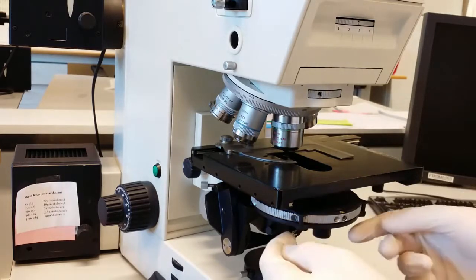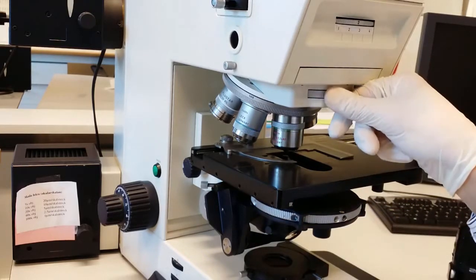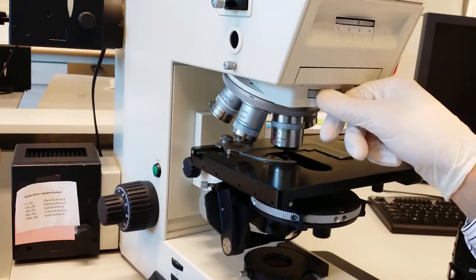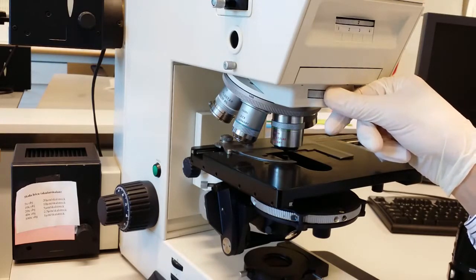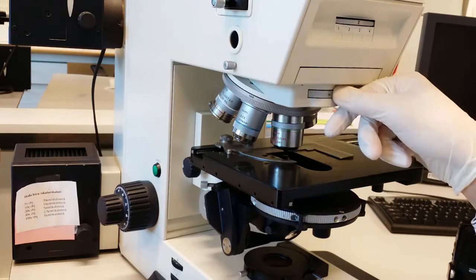You can adjust the position of the condenser with these two knobs down here. And with this wheel you choose the options of the Wollaston prism. And you have different settings here depending on if you do a differential interference contrast. Then you can adjust the effect of this, and you can choose the dark field option, or H, that's just the standard bright field option.